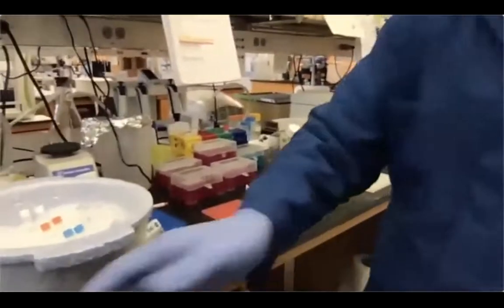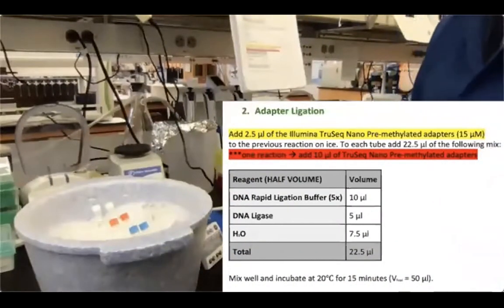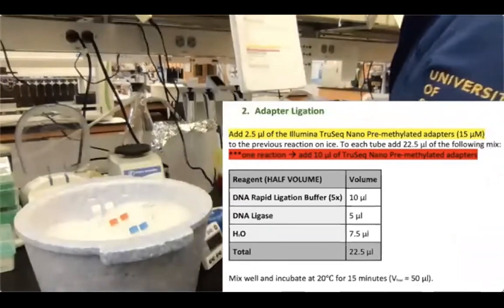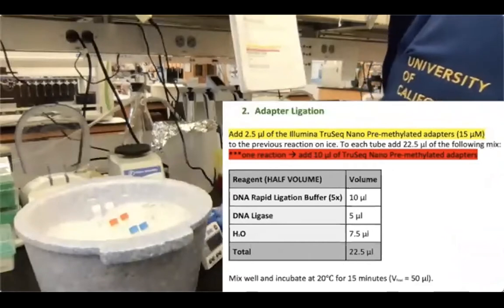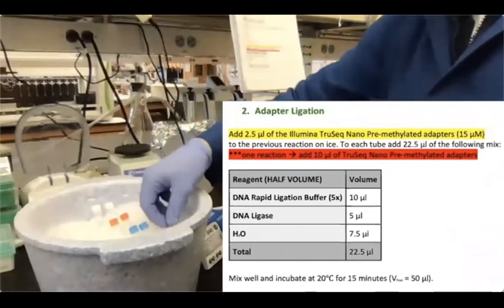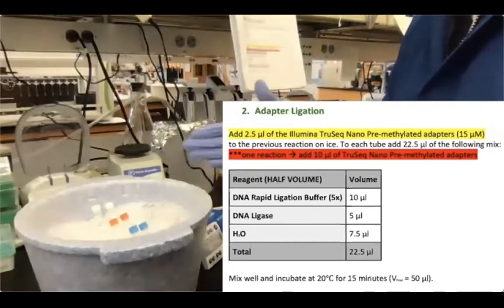So the adapter ligation step requires buffer, an enzyme, and the adapters themselves, okay? So how this reaction works is I'm adding the adapters first every single time, just because I prefer to have the adapters mixed with the end repair DNA before adding the ligase. Otherwise, ligase will start producing adapter dimers if you prepare a premix with the buffer, ligase, and the adapters.